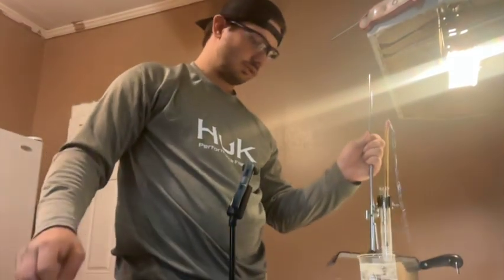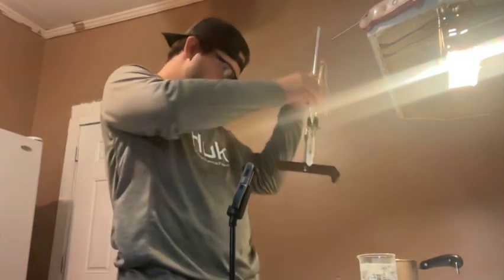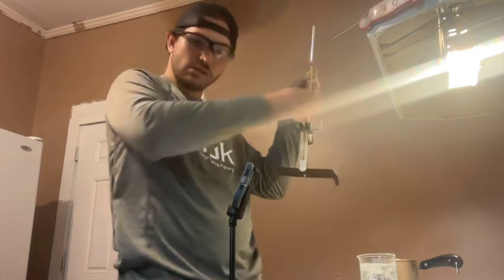And it's sitting at 47 degrees. Now we're going to remelt this.